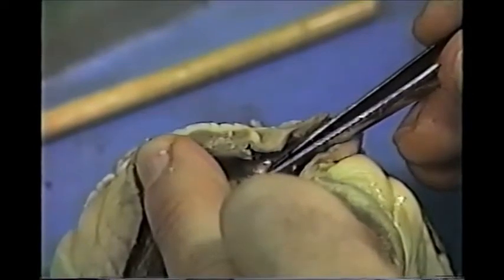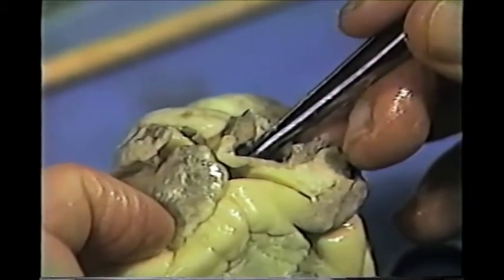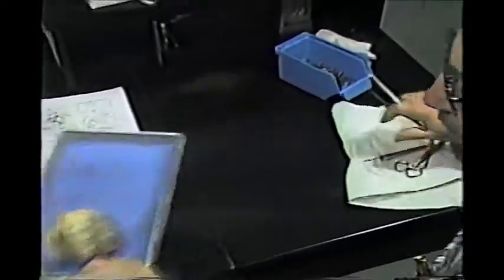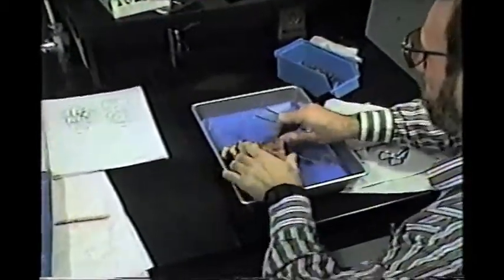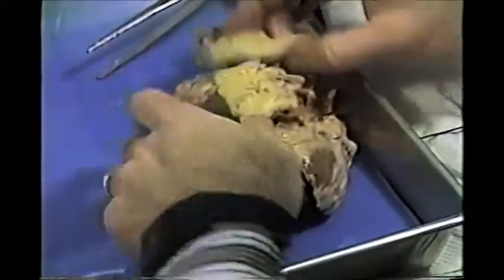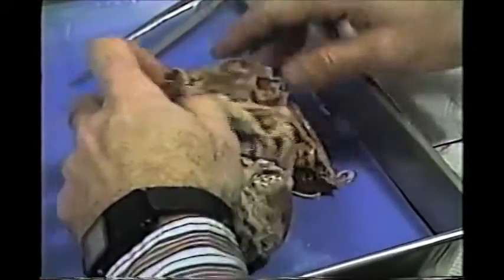There is a similar setup — another semilunar valve in the aorta, which is the major artery right here — and I'm going to show you that valve on the human heart. So what we're going to do is switch here. This is a preserved human heart that's all dissected, and we've had it for years. It doesn't look like much — I don't think this person died of a broken heart, but it certainly seems it.